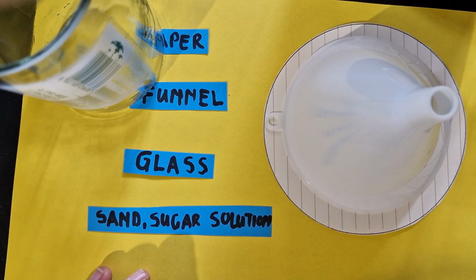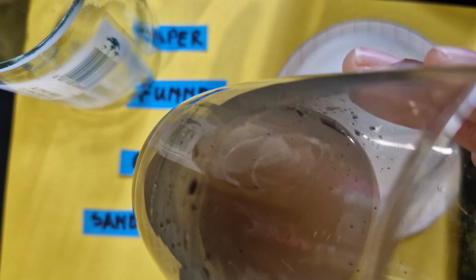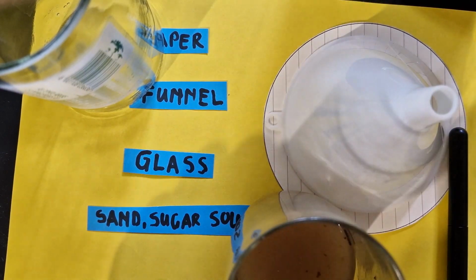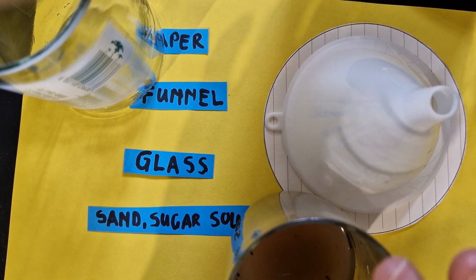And then the last thing is the mixture of yours, that solution of yours from step 1, where you have water, you have sand, and you have sugar. The sugar has completely dissolved into the water, but at the bottom, I don't know if you can see, we still have that sand. So those are the 4 things that you need to proceed with this step. So what do they do?